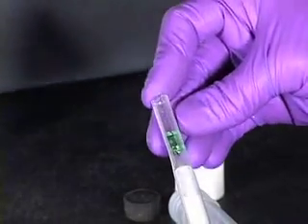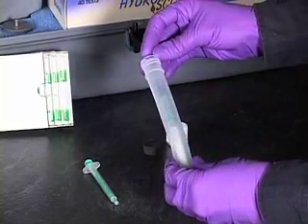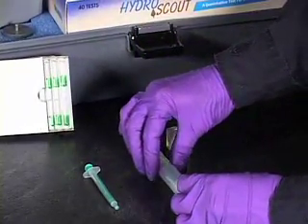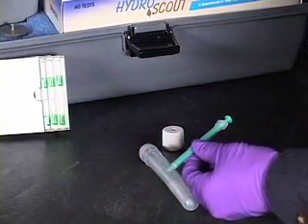Insert the green disposal ampoule into the top of the plastic straw and return the straw to the reaction tube. Using the green sampling syringe, draw up the oil until the plunger stops.